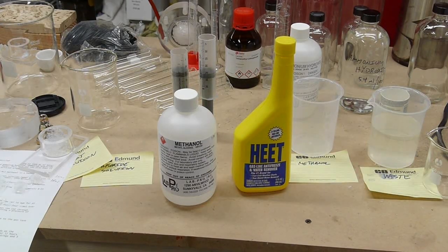On aerogel.org, they suggested putting, soaking the gels in methanol in the drying chamber. And that way when you add liquid CO2, there's no way it can hit the gel. So that might be a good alternative as well.